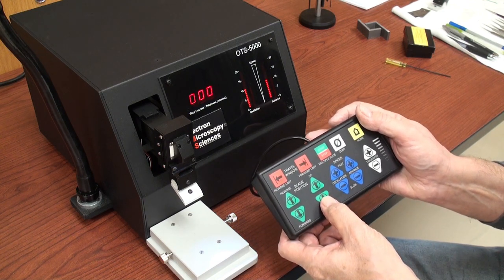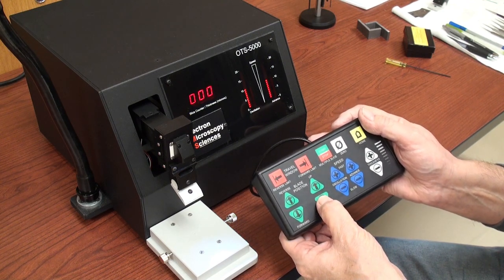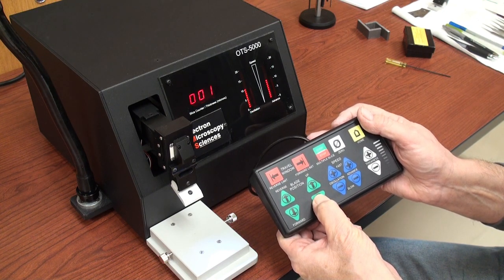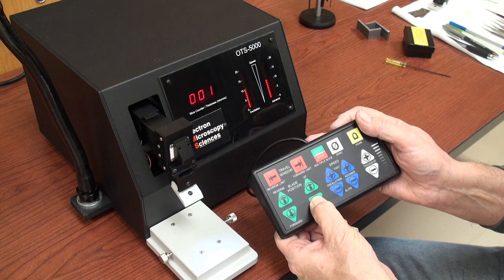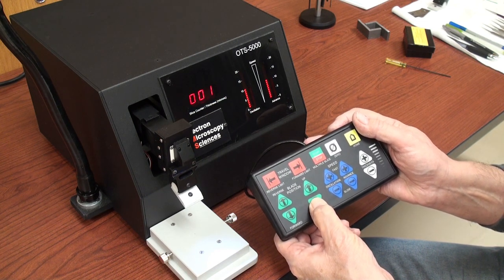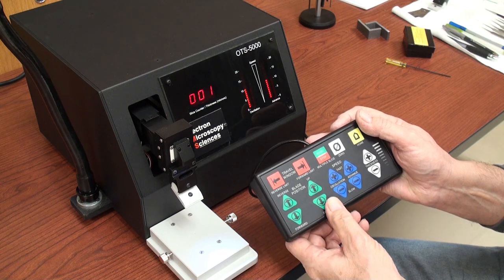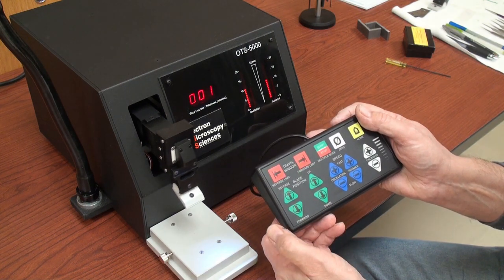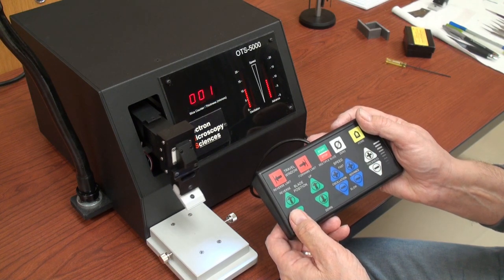Here we have blade position up and down. The arm moves very slowly but it is indeed moving. And again if you press up it will go up. Press forward and the arm comes forward.